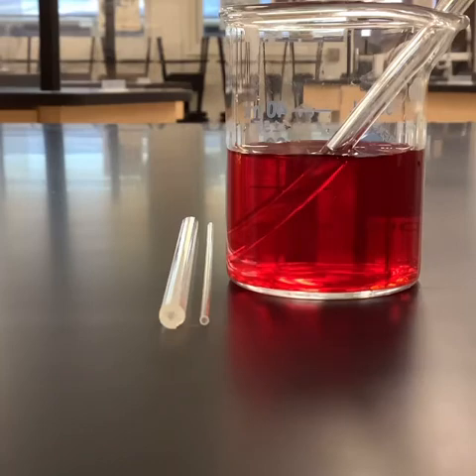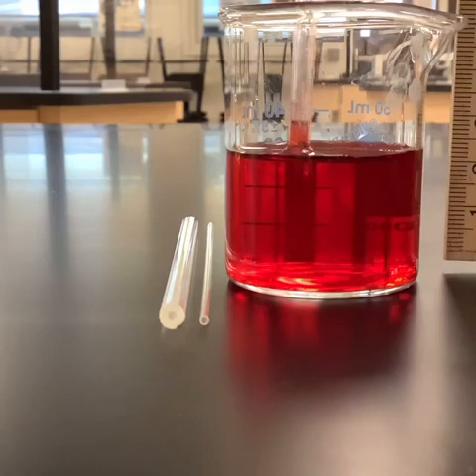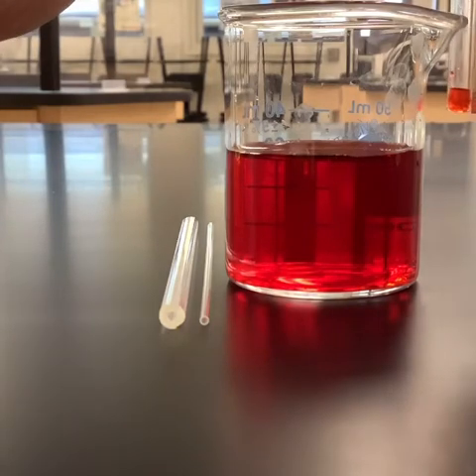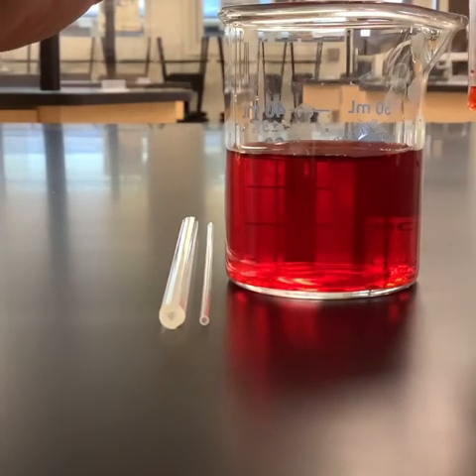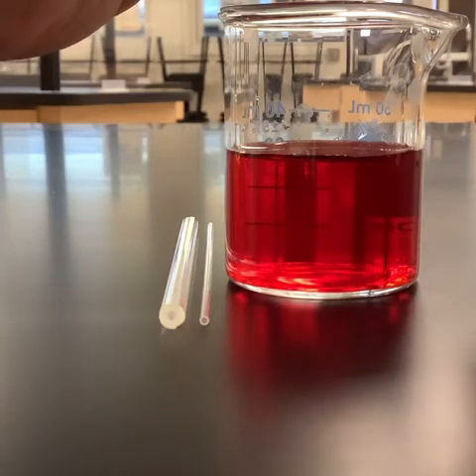See if we can measure it. So what we'll do, just to keep them all equal, is take it out and hold it up next to the ruler here, and see if we can measure the height of that. What do you guys think that is in terms of height that the liquid's able to draw up the tube?